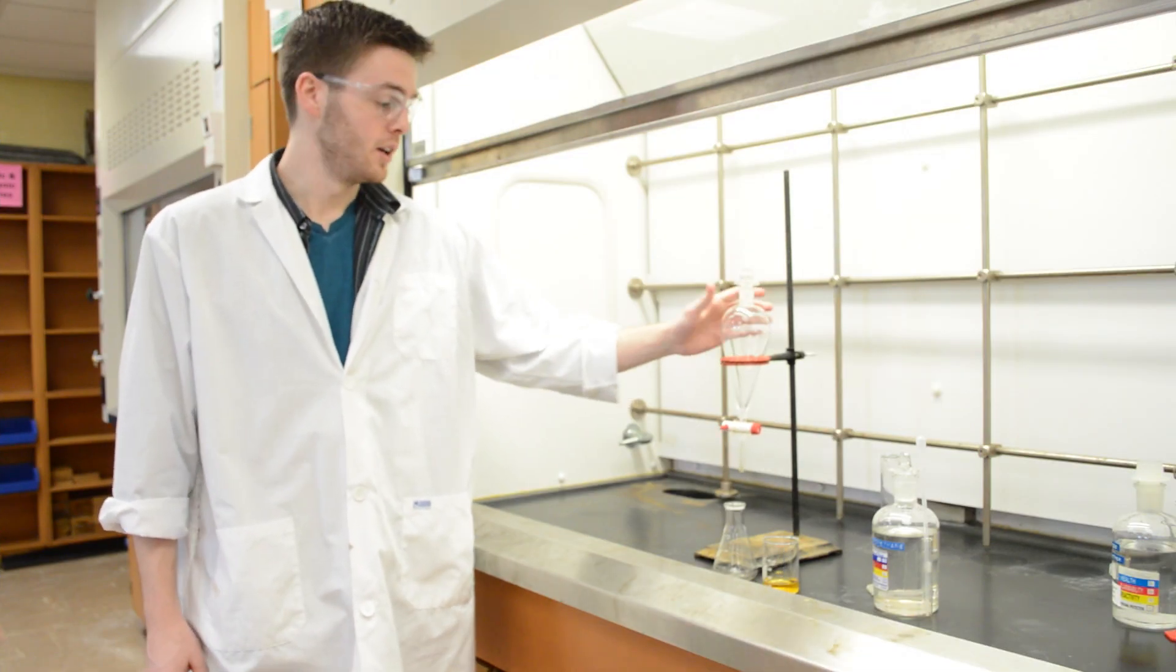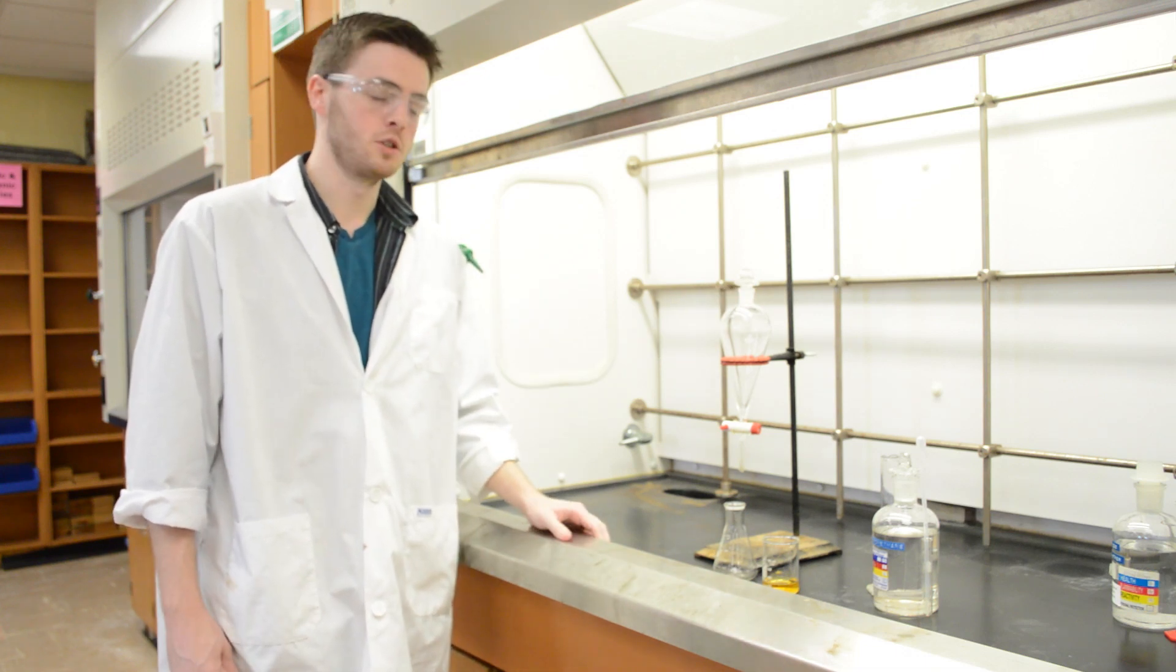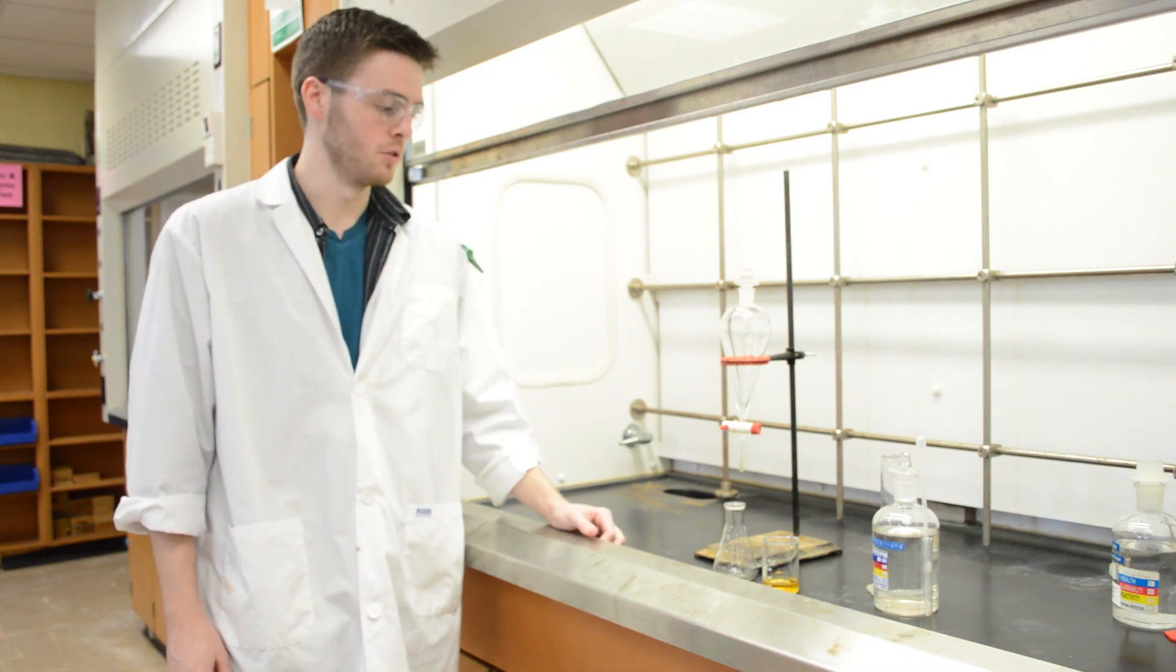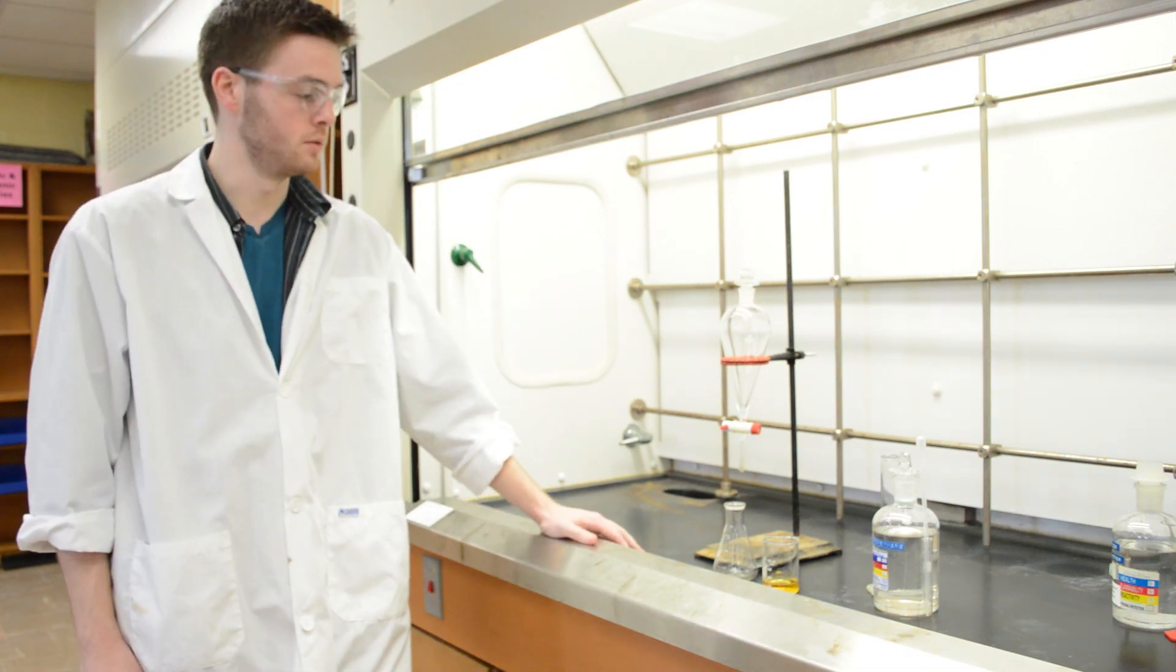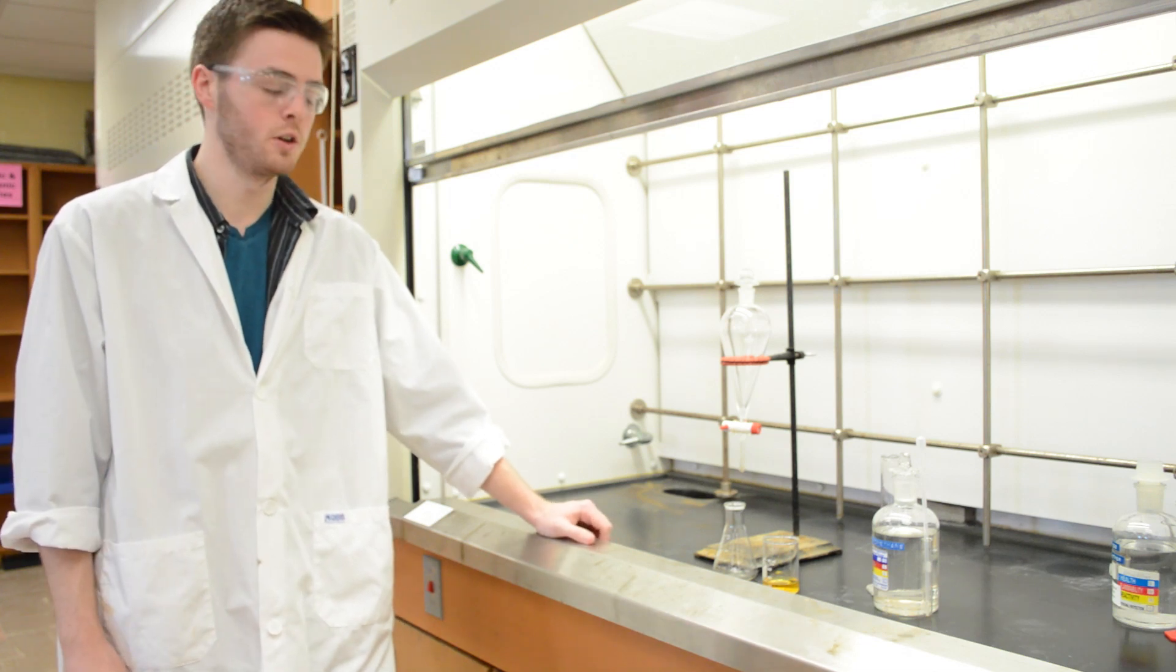So this is a separatory funnel, and what we can use this for is to extract certain materials into an organic layer from an aqueous water layer.